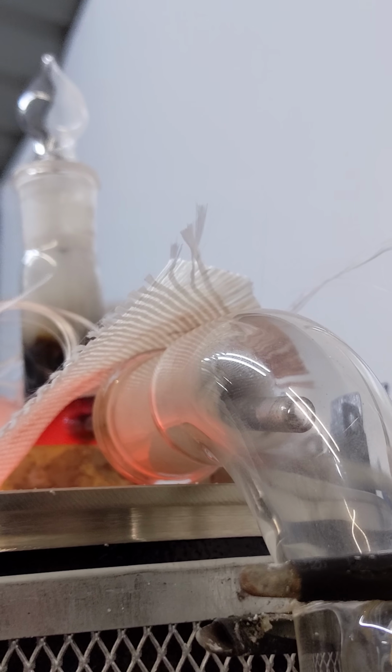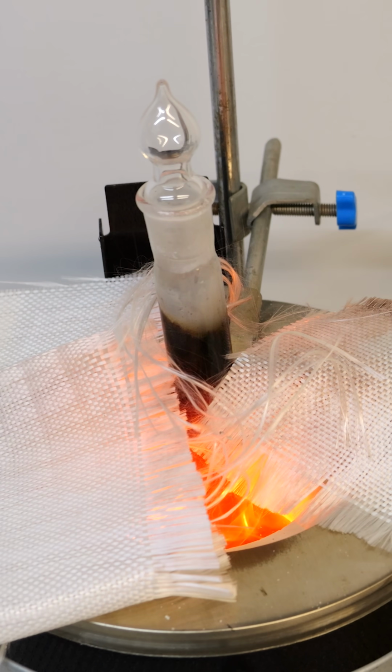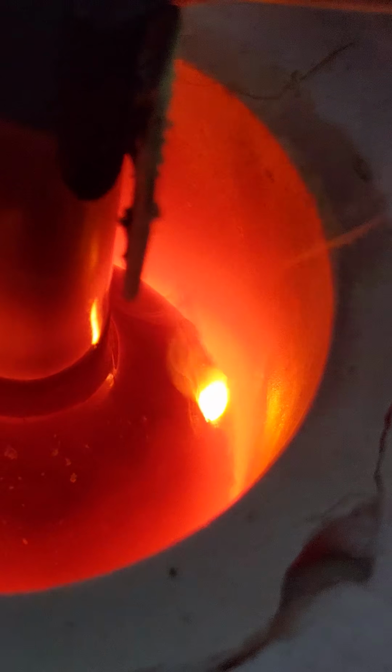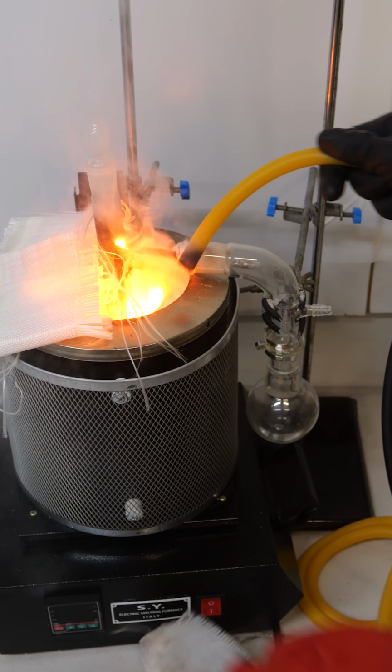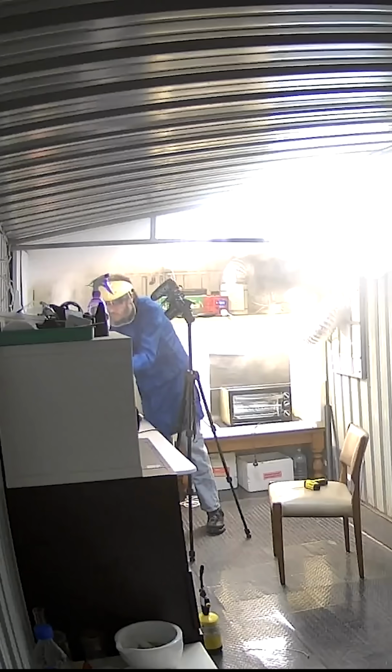Some potassium metal successfully boiled over, but something was wrong. A purple smoke filled the reaction flask, and a minute later, a fire started in the furnace. The quartz glass was dissolving away. I tried extinguishing the fire with argon gas, but this failed miserably and made it stronger. The shed was filling with smoke fast.